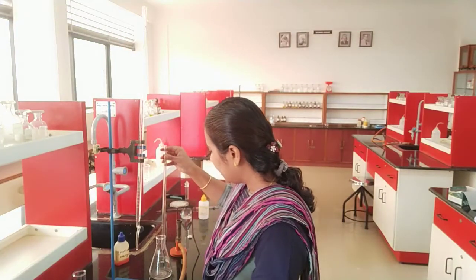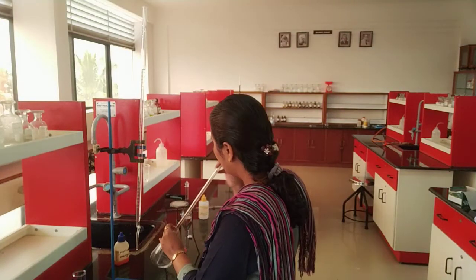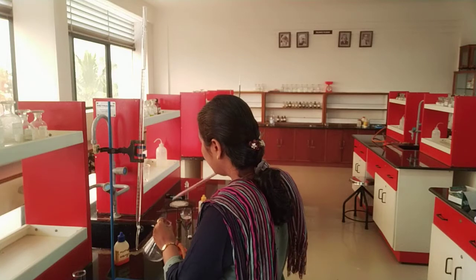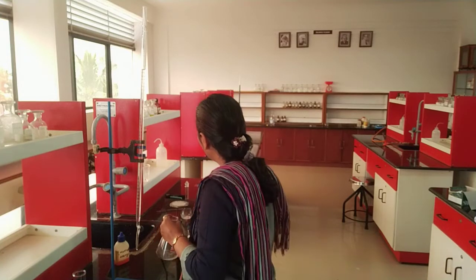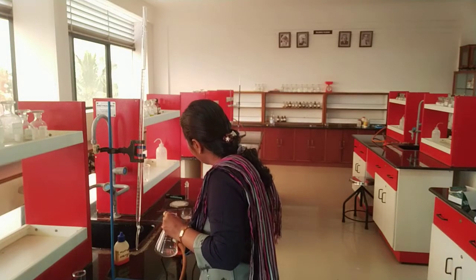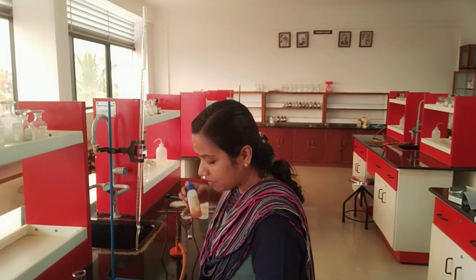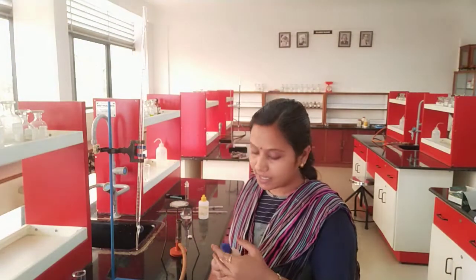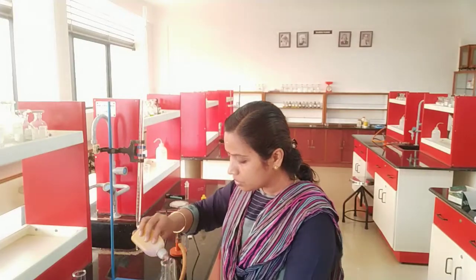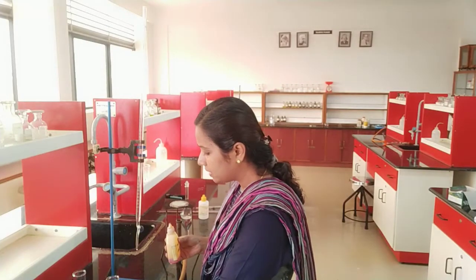And what indicator should be added here? The indicator to be added is methyl orange. For the previous experiment we added phenolphthalein as an indicator, and for this experiment 2 to 3 drops of methyl orange is added as an indicator.